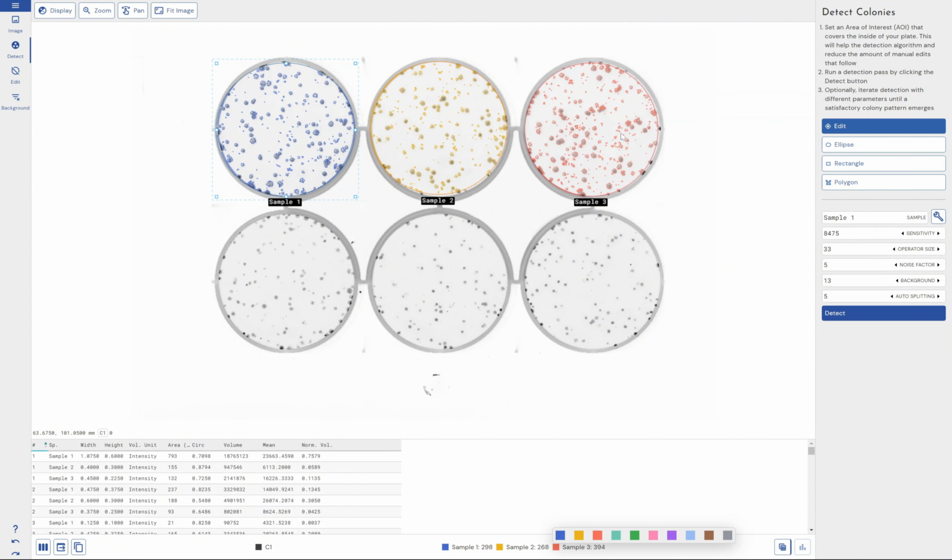We can change the color of their outlines by clicking on these buttons here, and we can display them here. So within my table, you can see we start to get immediate results. So we've got width, height, intensity of all of the different spots that we've got within our assay here. But what we can also do is go for spot count. So with the settings that I've applied, you can see sample 1 has 298 detected spots, sample 2 has 268, and then sample 3 has 394.